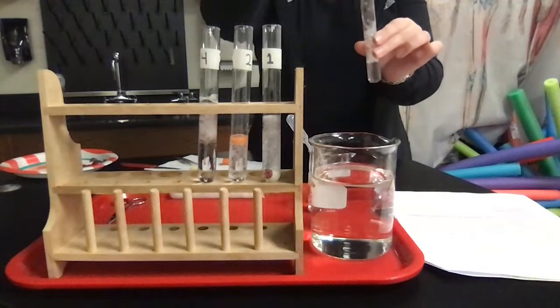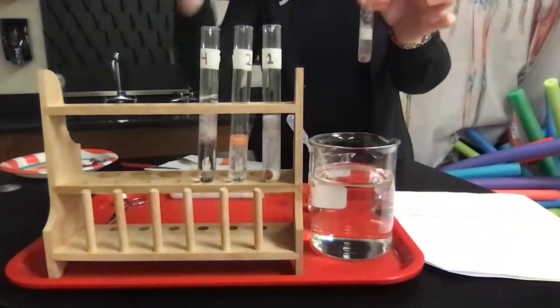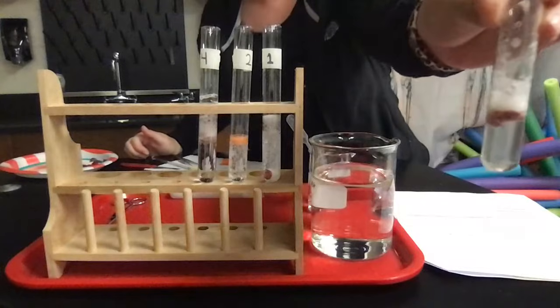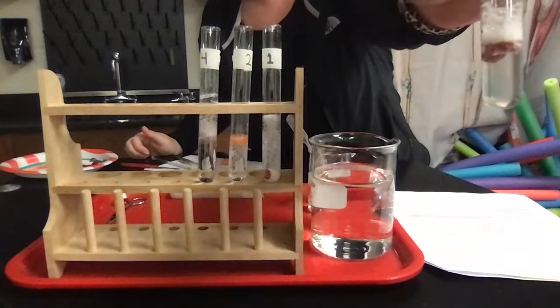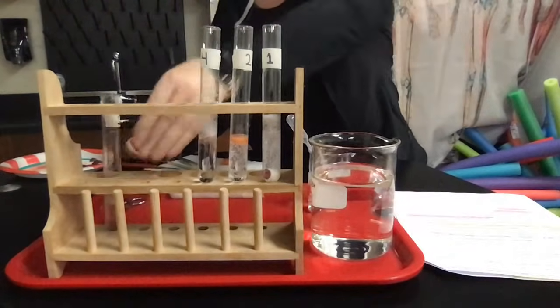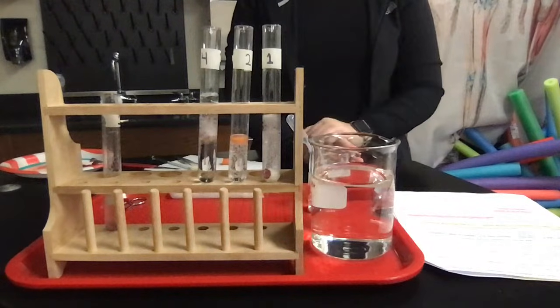Now, keep in mind, there are some bubbles still at the top from the last time. You see a little bit of bubbling happening, but the bottom of that is pretty still, right? I'm going to say that that's mostly water in there, which means that our catalase totally worked. So is the liquid reusable? No, because it should just be water after the reaction takes place.